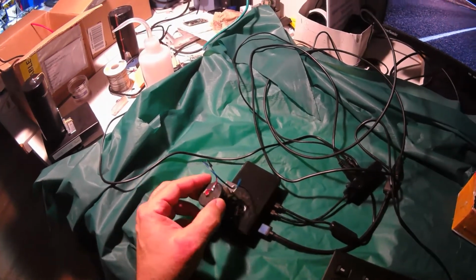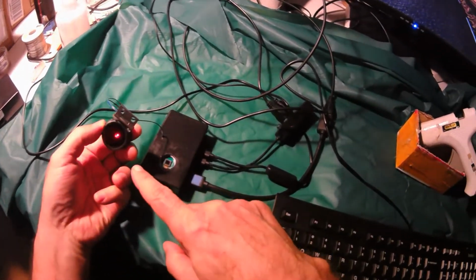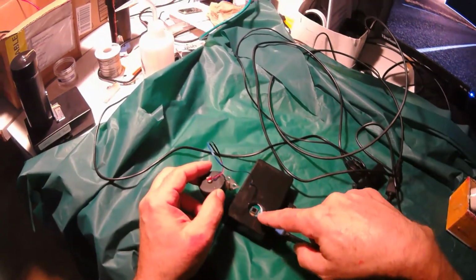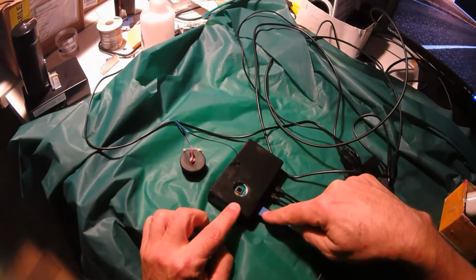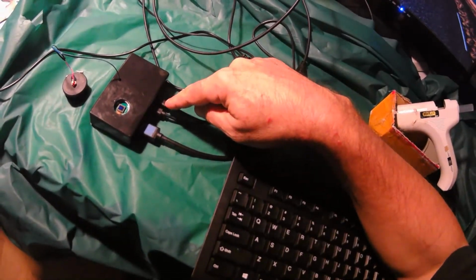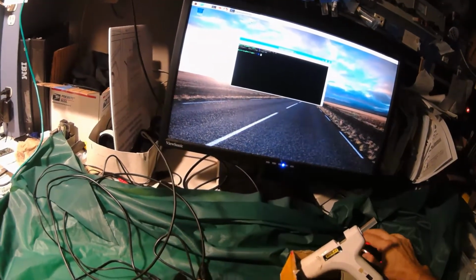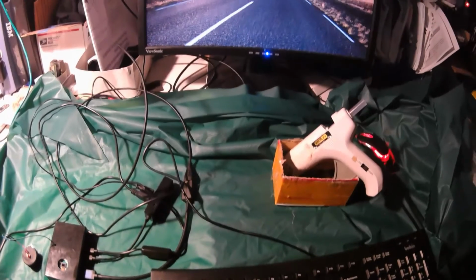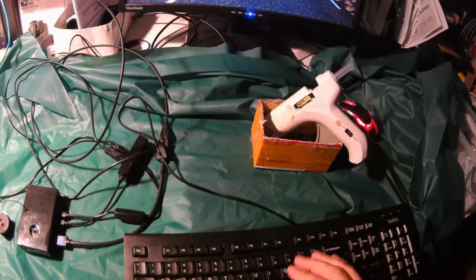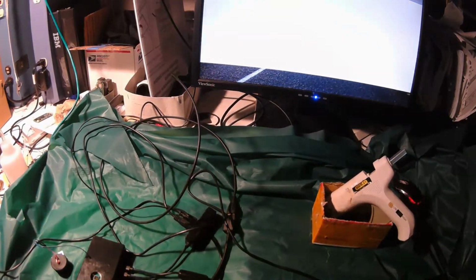The next step is to align the laser with the image sensor. So here's the laser. Not supposed to look at it, but the camera can look at it. That's the laser. That's the image sensor and the protective glass. And so we have the HDMI, the USB, and the power hooked up, and the Raspberry Pi operating system powered up. We launched the terminal, and now by typing raspivid -t 0, that means it'll infinitely display what the camera sees. And now we can tell it's running because it's sensitive to light.